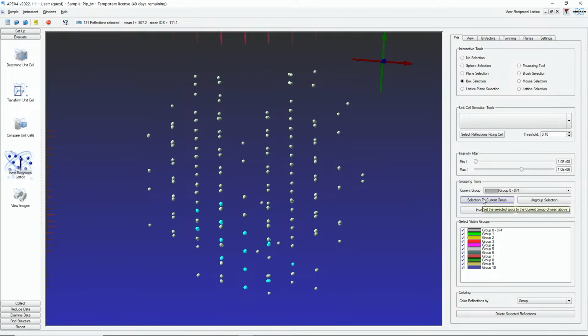So what I will do is, we have this nice feature that we can put reflections into different bins, and they're color-coded, so we can keep them apart. I want to keep the ones that are selected now as my first choice. So I will invert the selection, and then put all the other reflections into the second group here, into the green group. Is that going to be a problem that you didn't select all of the reflections for that one? No, in this case, we only need to determine the unit cell. I will not delete the reflections from the diffraction images.